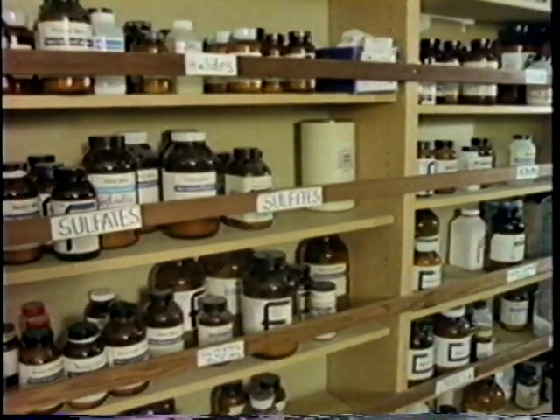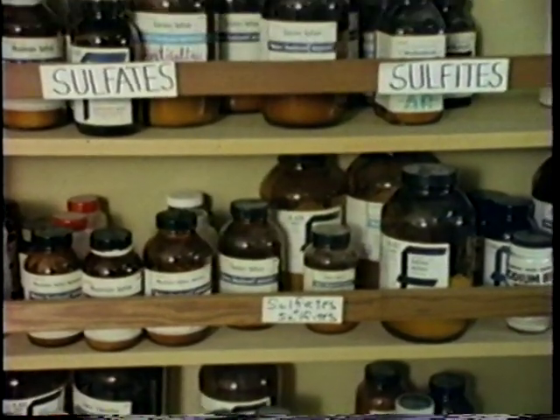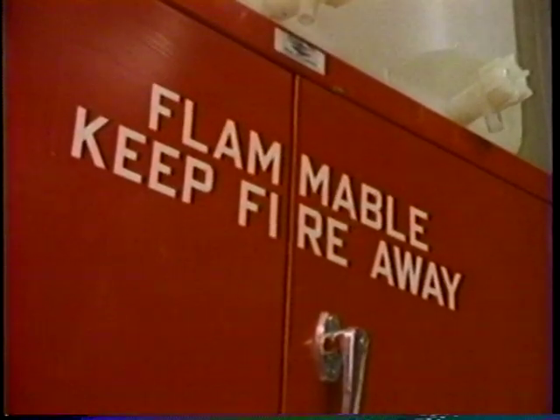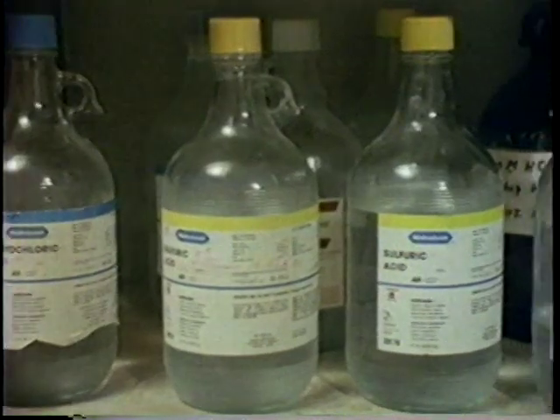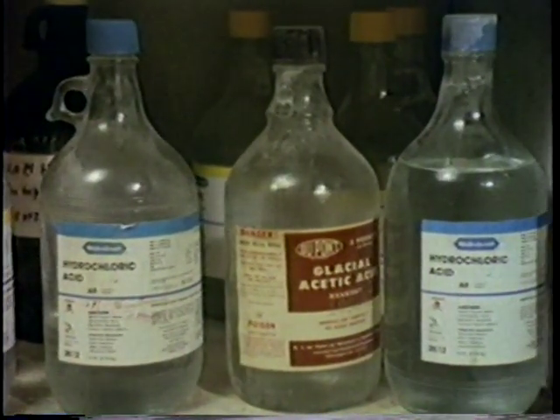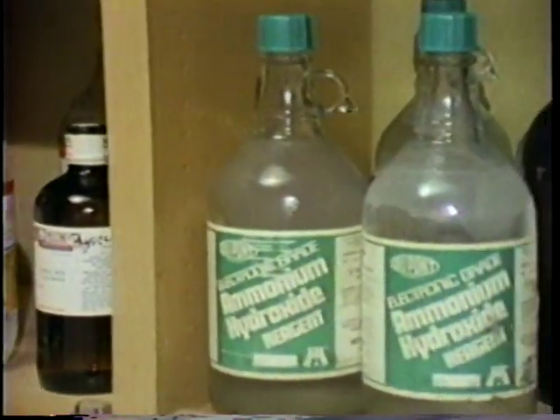Mr. Petrie told us how each and every chemical in his lab had been completely and properly labeled and stored in the proper manner. Flammable and volatile liquids were placed in a special storage cupboard. Caustic materials were on the lowest shelves, less chance of their falling. But they were off the floor in order to avoid contact with water. Incompatible chemicals, those that should be separated, were in different storage areas. It may have been a high school chem lab, but I could see this wasn't kid stuff.